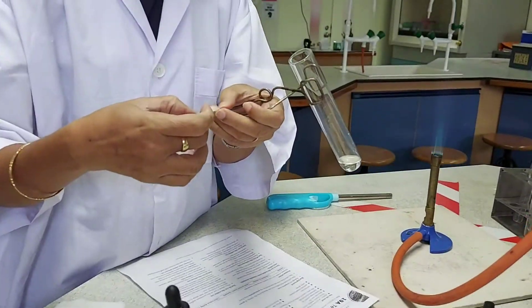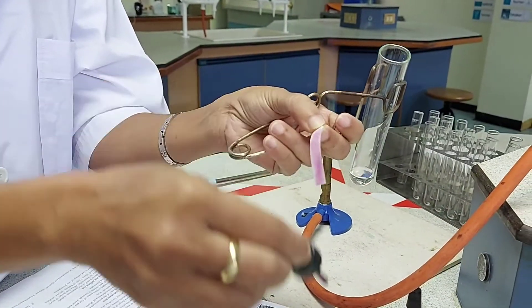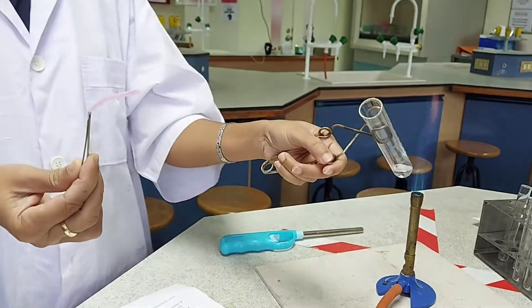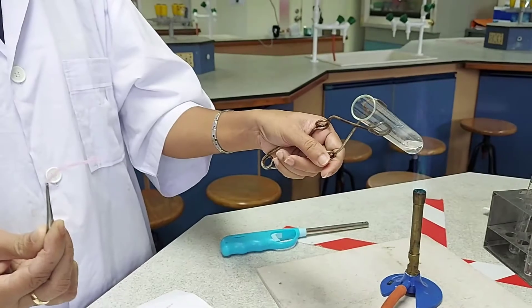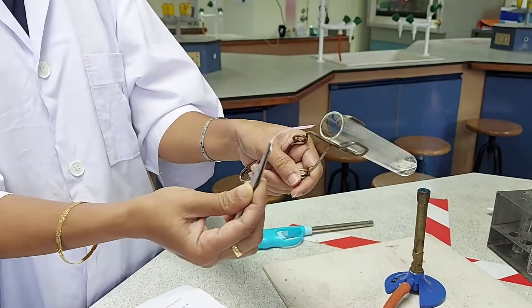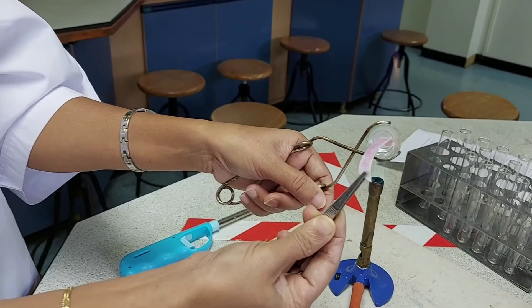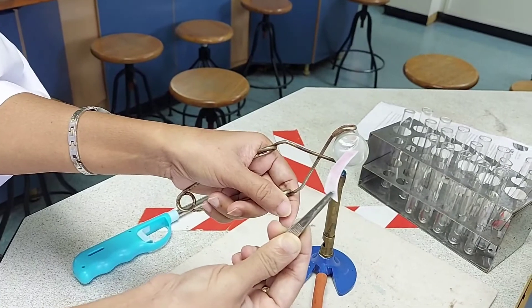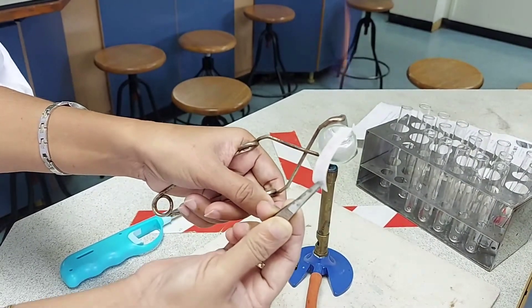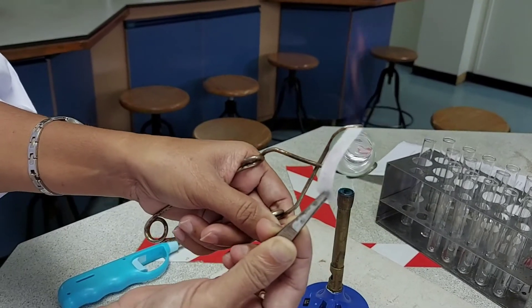I will be testing the presence of the sulphur dioxide gas by using a filter paper soaked in potassium permanganate solution. I am soaking the filter paper with potassium permanganate solution and heating the given solution mixture. As the solution mixture is heated, a gas is getting evolved. I am bringing the filter paper soaked in potassium permanganate close to observe what happens — the pink colour of the potassium permanganate is getting decolourised by the evolved gas.